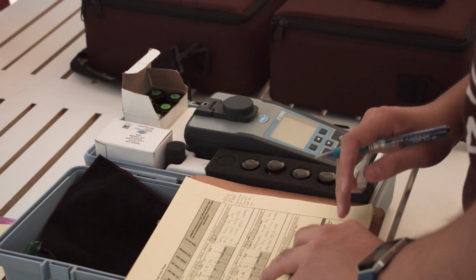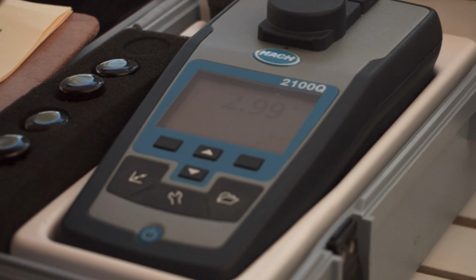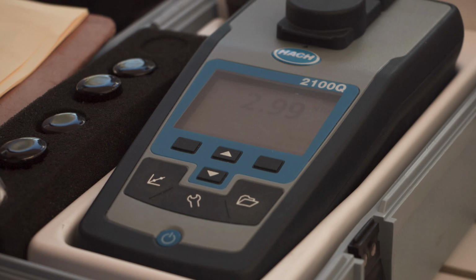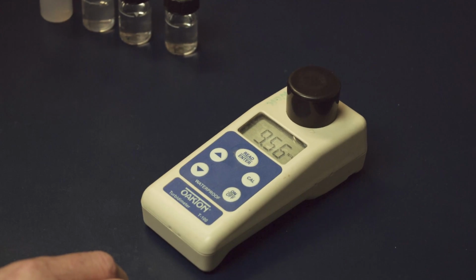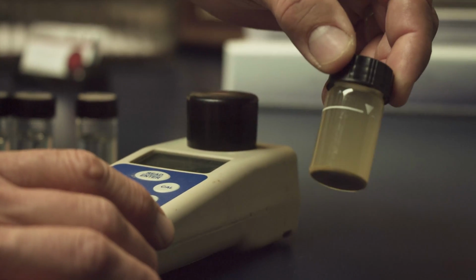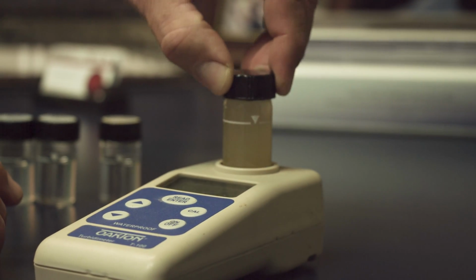So what did we learn from our little experiment here? Well, we learned that abnormally low NTU readings in the field may mean you've encountered an equipment limitation. The sample could be so turbid that it confuses the meter into reporting an NTU value much lower than it actually is. But it looks like you can get around this by allowing the sample to settle for a few minutes. But be careful, don't let it settle to the point where it's no longer a representative sample.